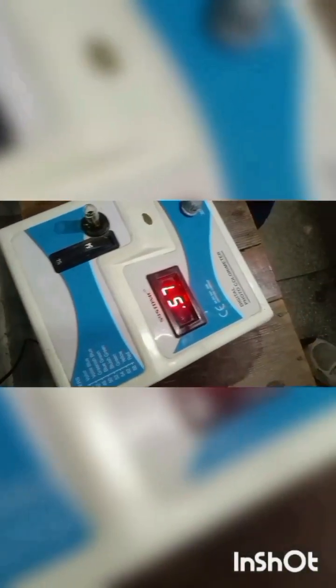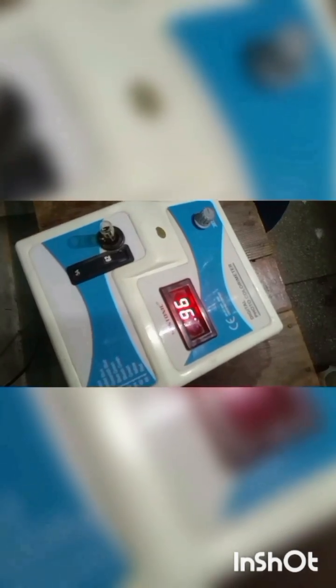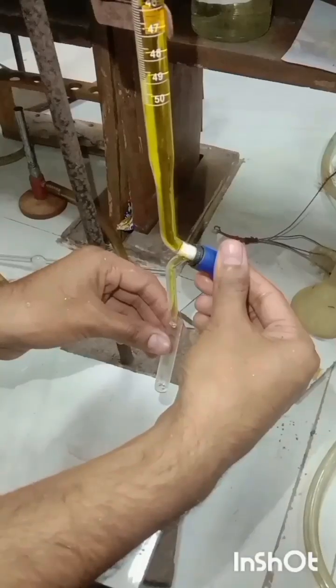At 540 nm the absorbance value comes out to be 0.57, at 620 nm it is 0.98, and at 680 nm it is 0.29. From these readings we can determine that lambda max is equal to 620 nanometres, as it shows the highest absorbance.